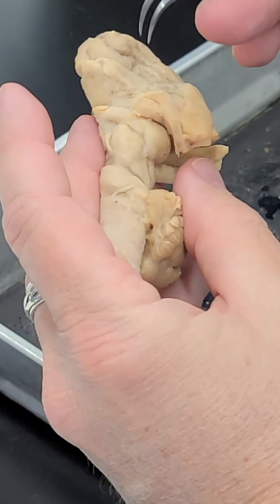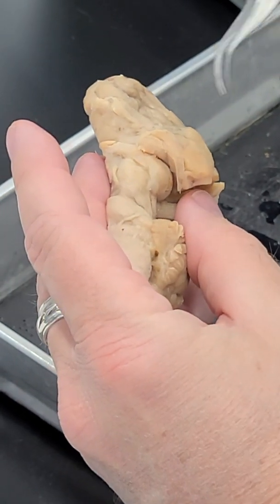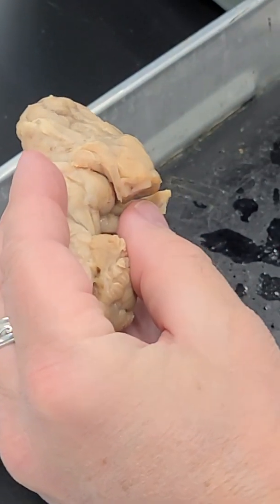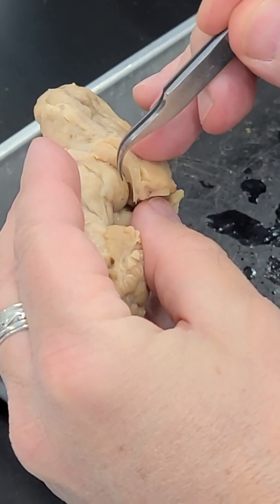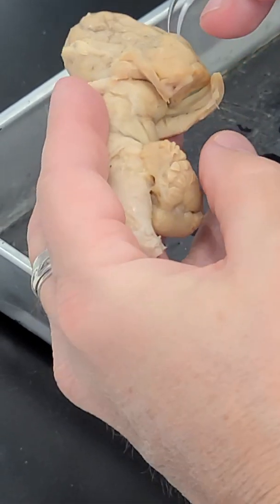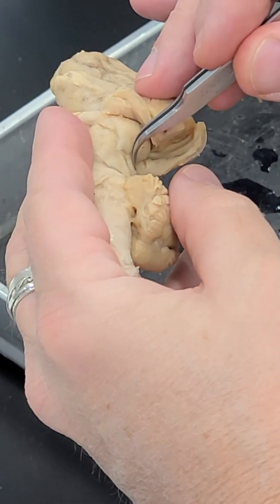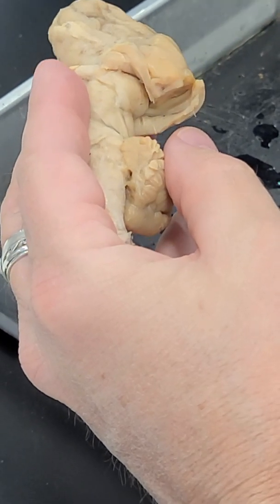And one of the keys with the lateral geniculate nucleus, if you follow the optic tracts from the chiasma around the brainstem, the optic tracts come up and much of the fibers terminate here in the lateral geniculate nucleus. And so that's the swelling that's up here right at the end of the tract. And then a lot of the fibers that don't synapse there will continue into the midbrain and go to the superior colliculus. And so these 2 structures here are the primary targets of the ganglion cells from the retina.